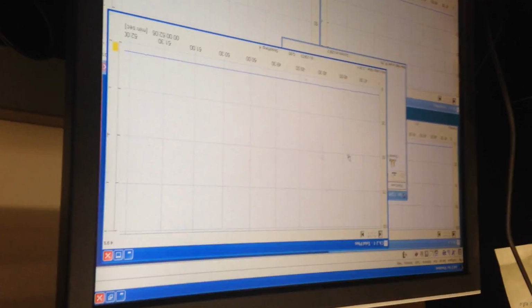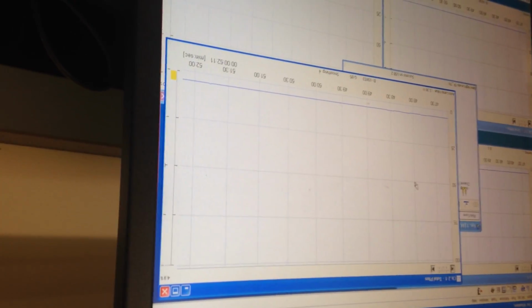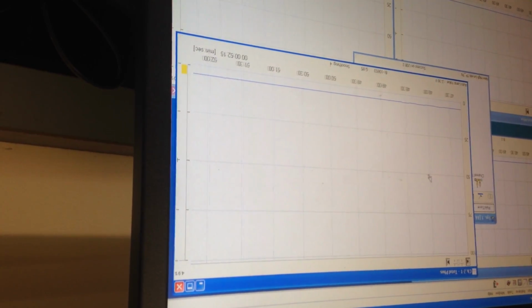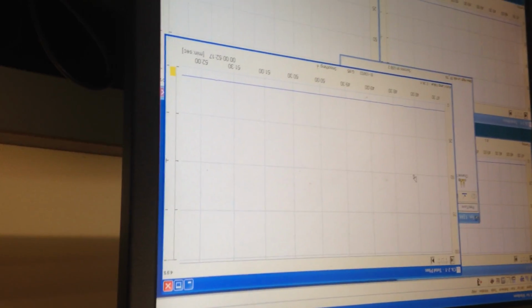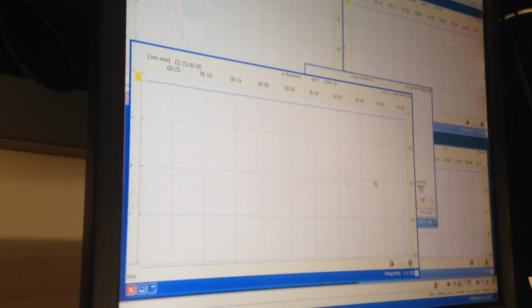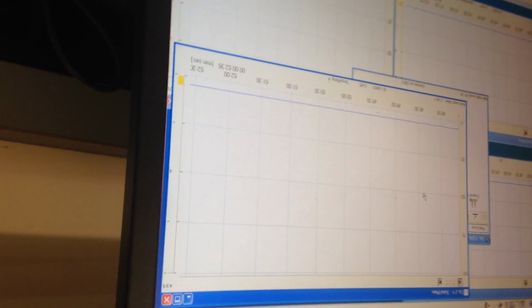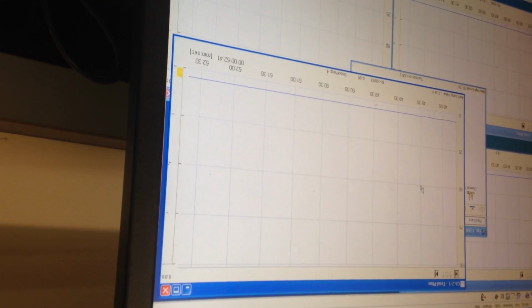Usually you see at least some bump from background matrix. My only thought is the last time we ran phosphorus, it was already at the right baseline. It already had a baseline with the background matrix from the last run, so maybe it was just a similar background, so it didn't have a big signal. Yeah, just remember that problem with the precipitate. That's why I'm asking if that's possible here too. Yeah, usually in times where I haven't seen a big bump from the background matrix, you still get bigger peaks going through.